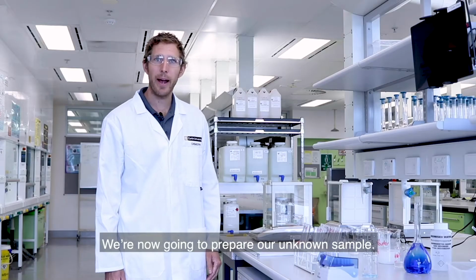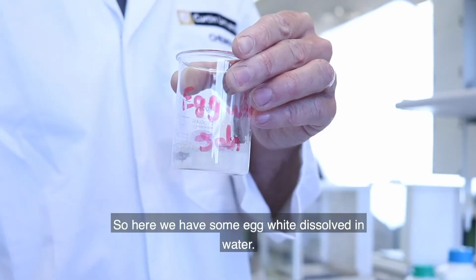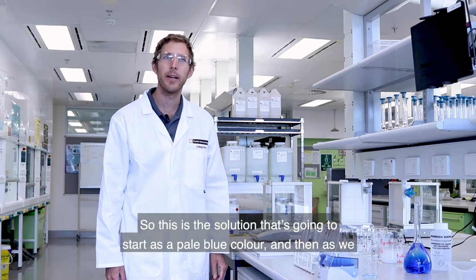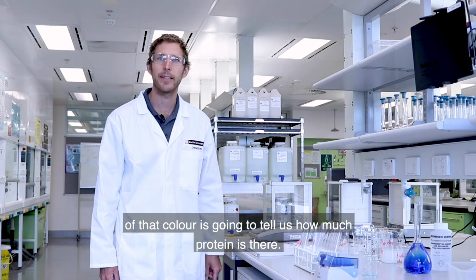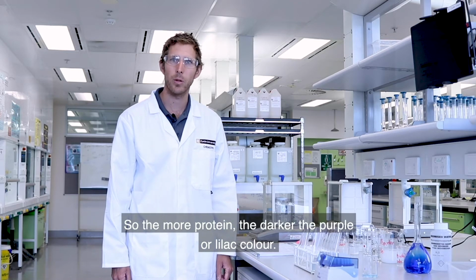We're now going to prepare our unknown samples. So here we have some egg white dissolved in water. We're now going to prepare our biuret solution. This is the solution that's going to start as a pale blue color, and then as we add protein to it, is going to turn into a lilac or a purple color. And the intensity of that color is going to tell us how much protein is there. So the more protein, the darker the purple or lilac color.